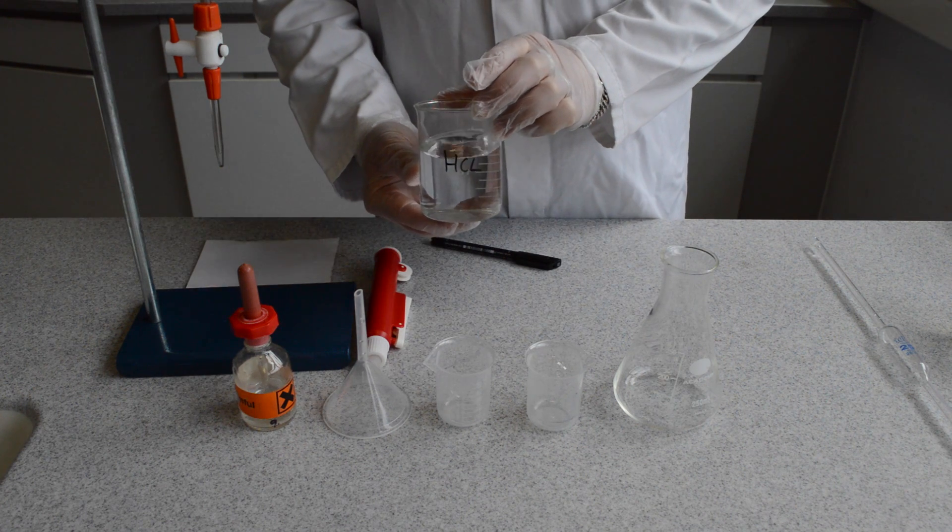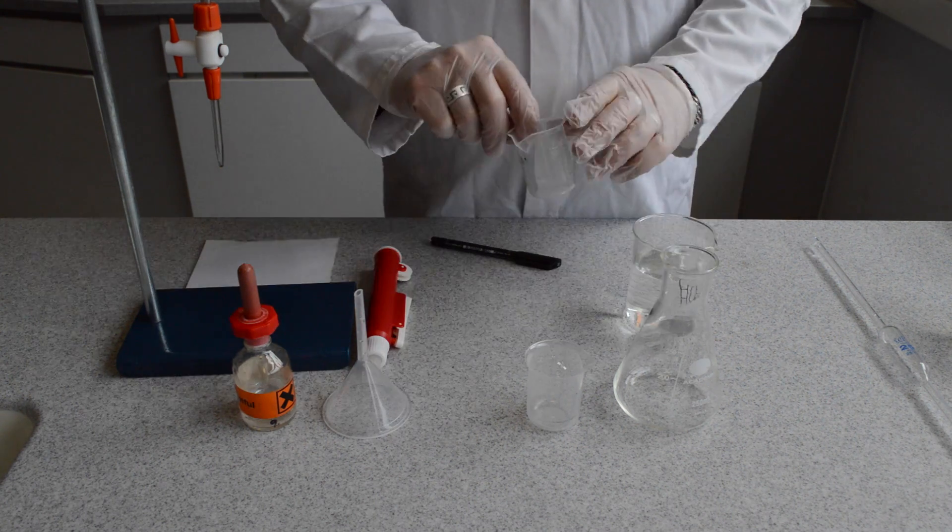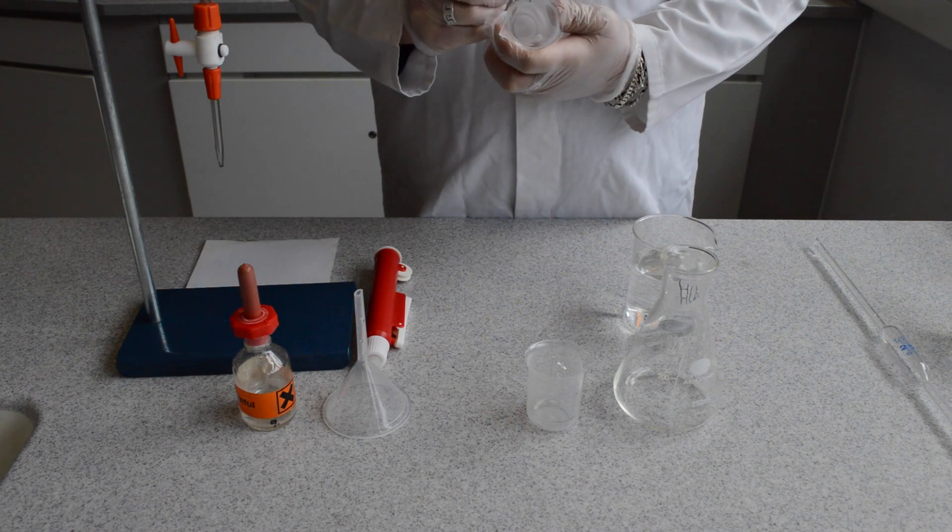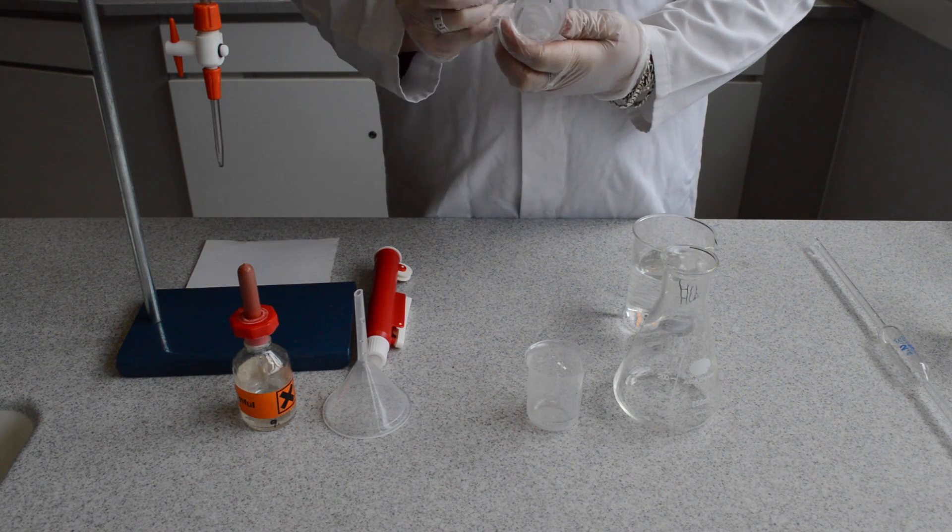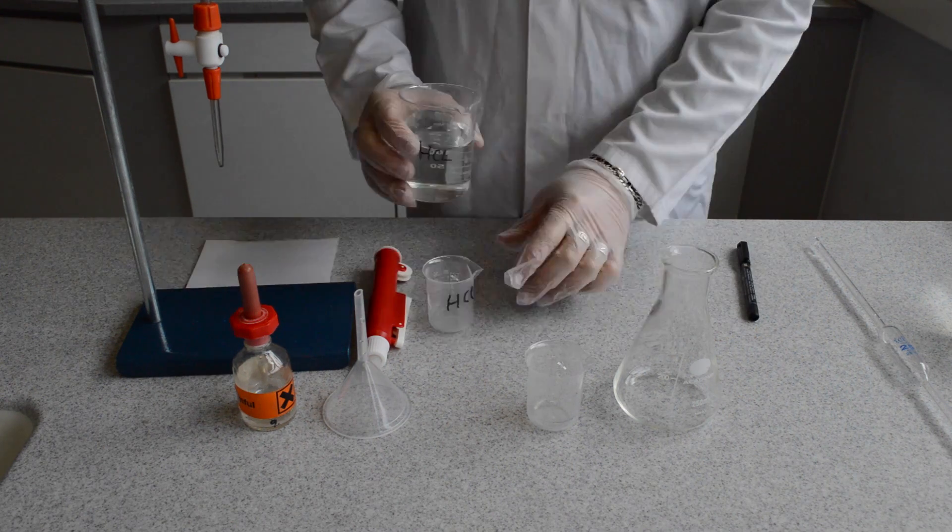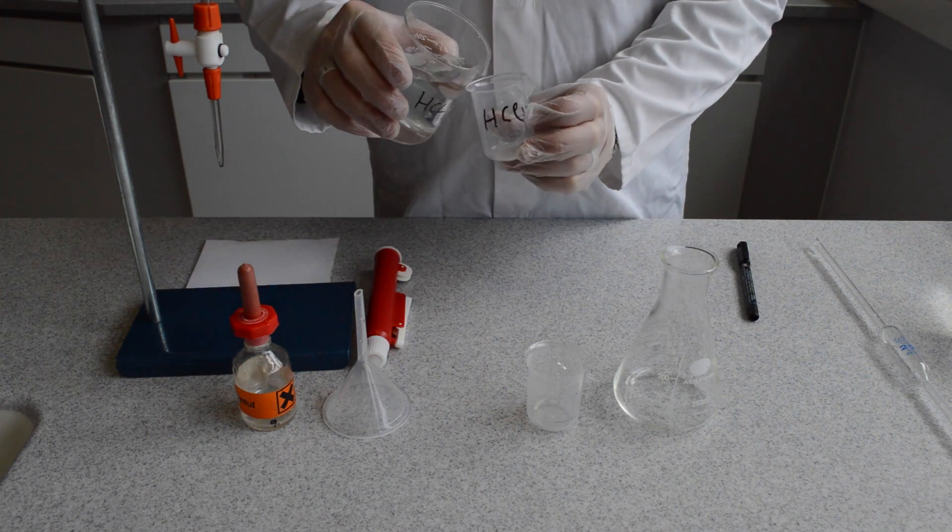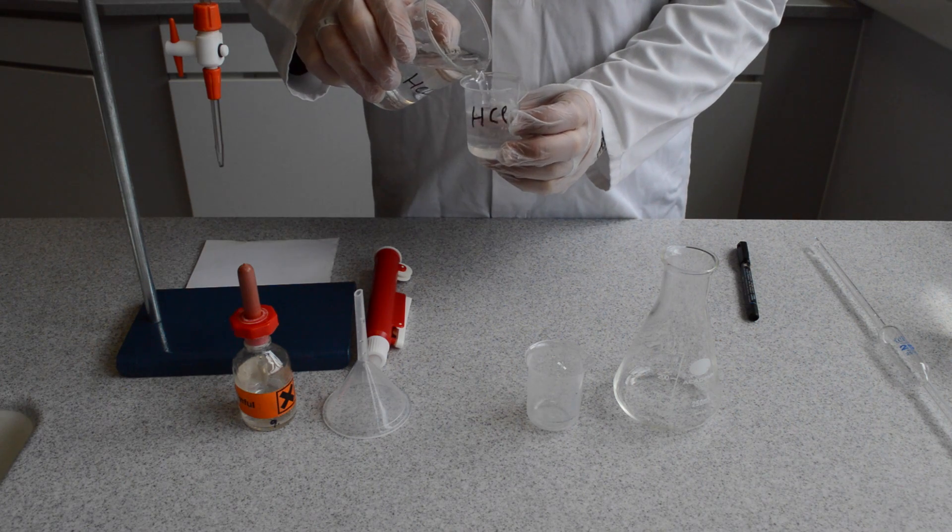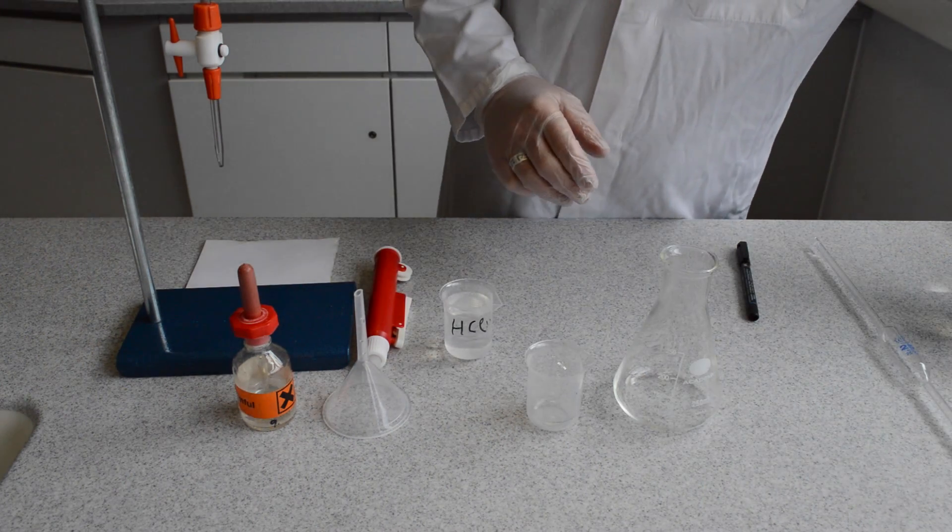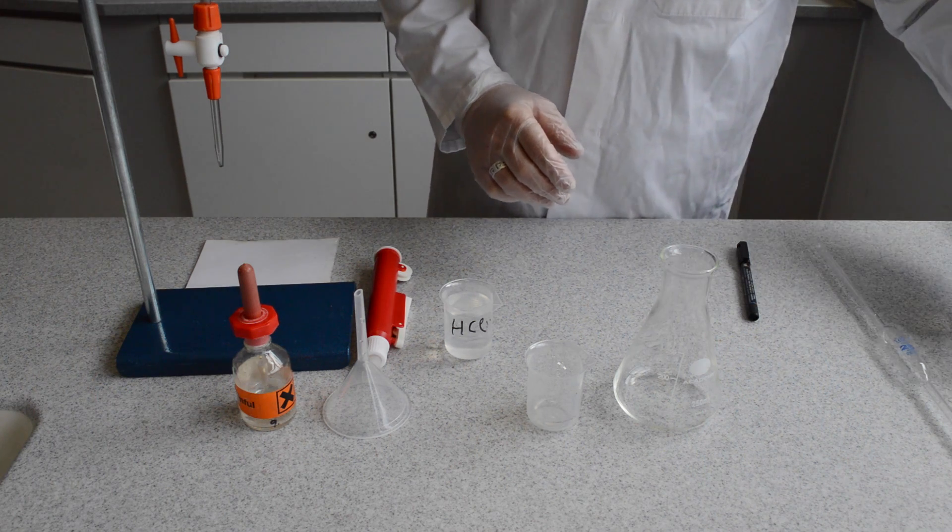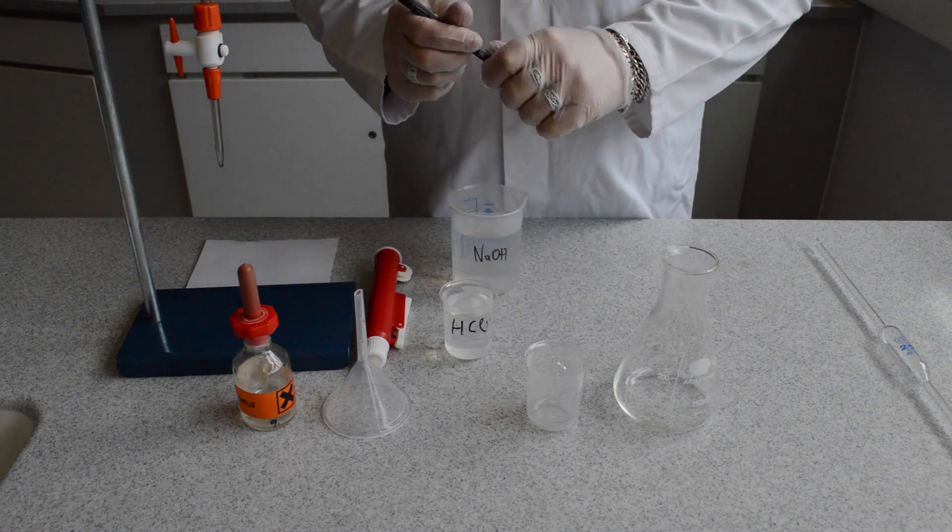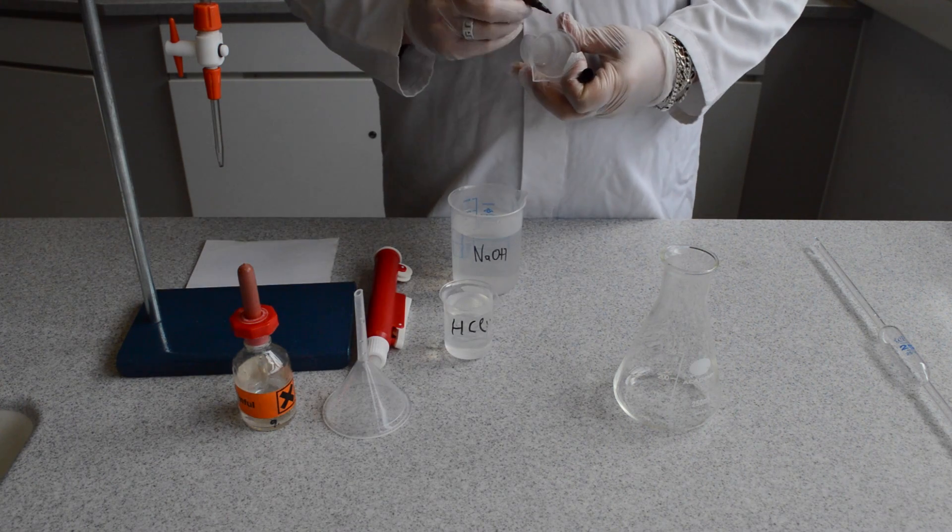In the laboratory there will be a supply of hydrochloric acid and sodium hydroxide. Collect some of these in individual beakers for single experiment use. Please label the beakers before decanting the various solutions. By labelling the beakers in advance before decanting the liquids will avoid any chance of contamination.